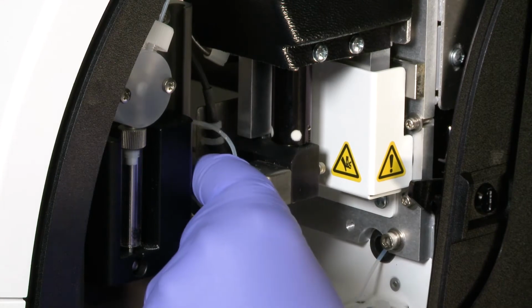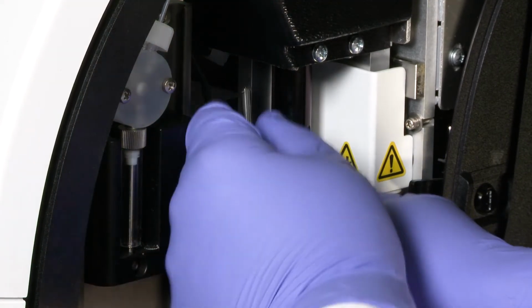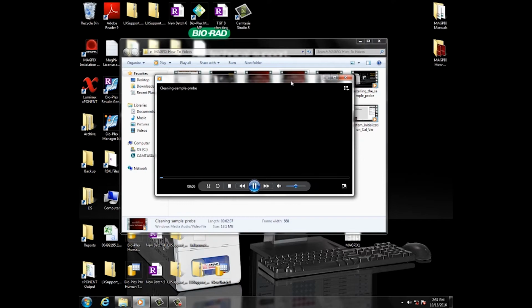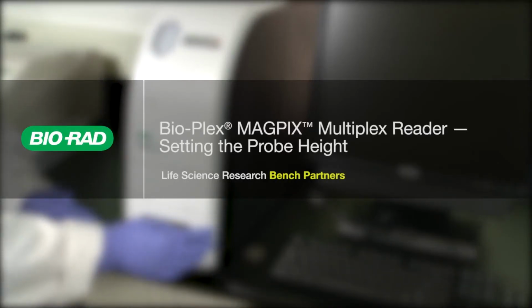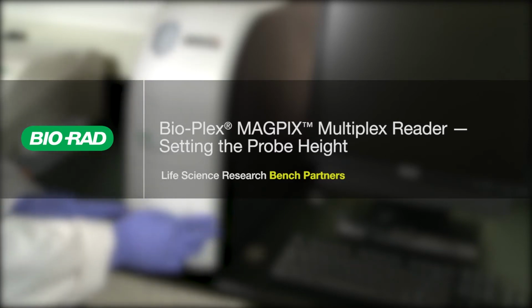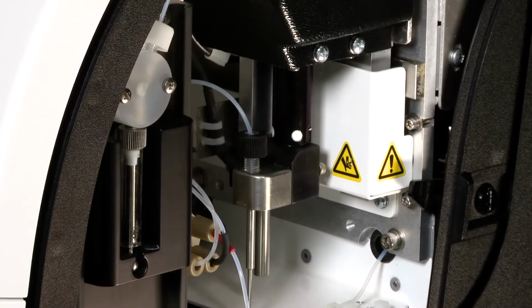Start troubleshooting by removing and cleaning the sample probe and making sure the sample probe height is set correctly. Instructions for cleaning the probe are provided in the how-to videos that come with the instrument. For instructions on setting the probe height, refer to the Setting the Probe Height on the Bio-Plex MAGPIX Multiplex Reader video available on the Bio-Rad Life Sciences YouTube channel.